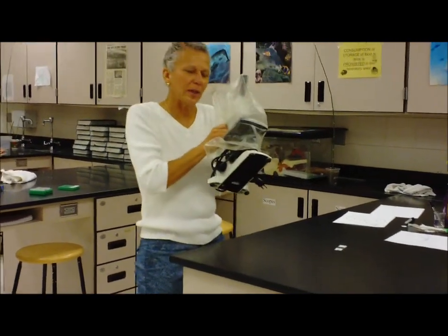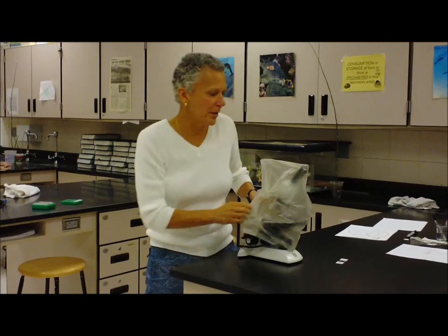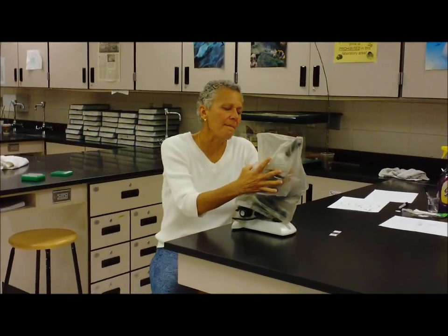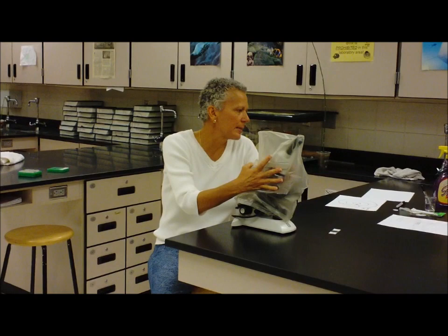When we carry a microscope, we're always going to carry it with two hands to make sure that it doesn't drop. We're going to store it with the cover on so that it doesn't get dusty.